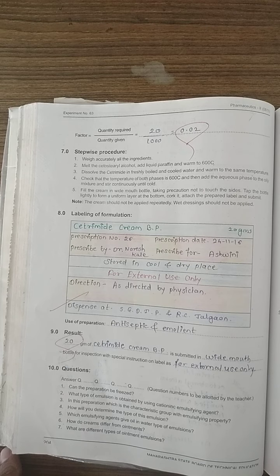First prepare the oily phase with liquid paraffin. Then add the aqueous phase — containing cetrimide — to the oily mixture of liquid paraffin and cetostearyl alcohol. Mix continuously with stirring until it is cooled.